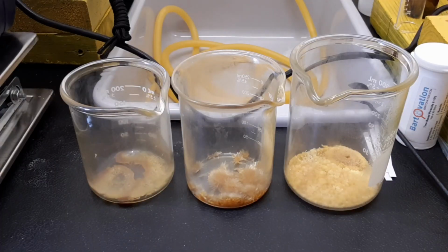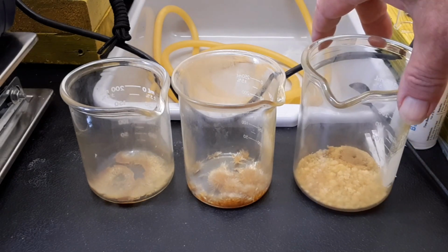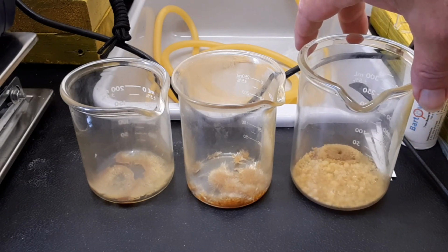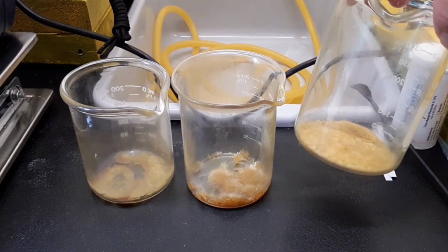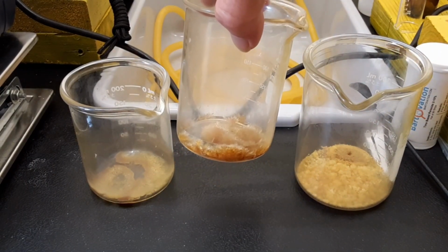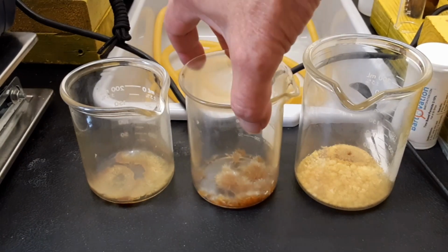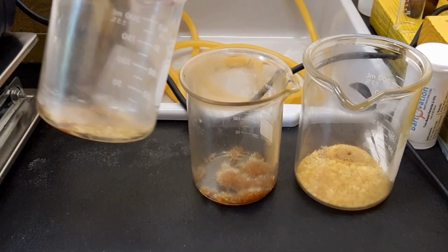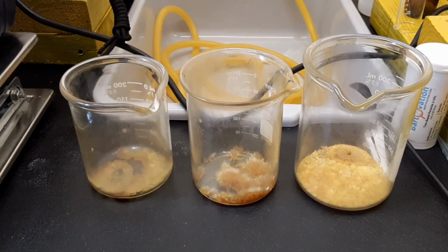So anyway, that's what I ended up with there. 3 completely different results in varying proportions. I don't know if I should go ahead and try to do a recrystallization on this, because this here didn't have a recrystallization. Whatever formed in here formed the first time. This one here technically didn't have a recrystallization, but I did wash it with acetone to try to get the brown out. And this one here was crystallized so many damn times there's nothing left of it. That's what I come up with.